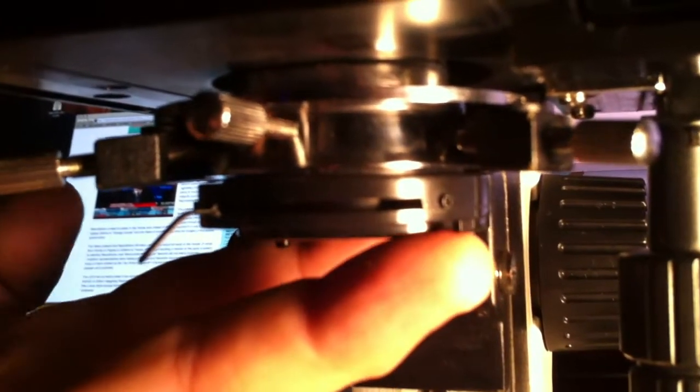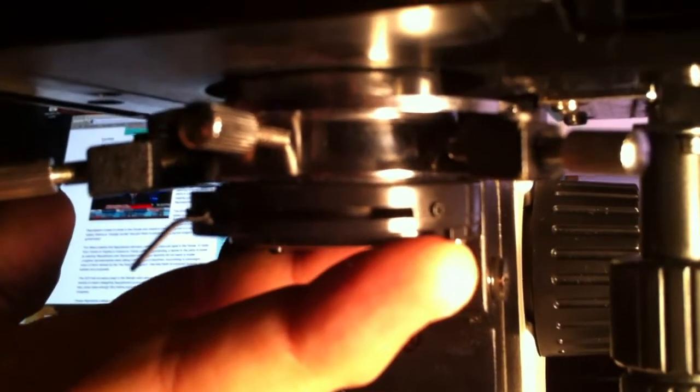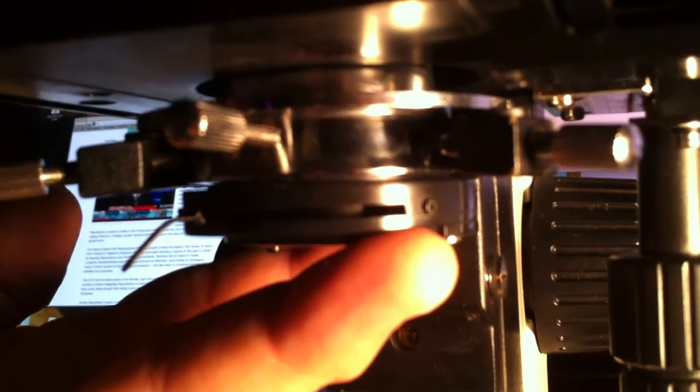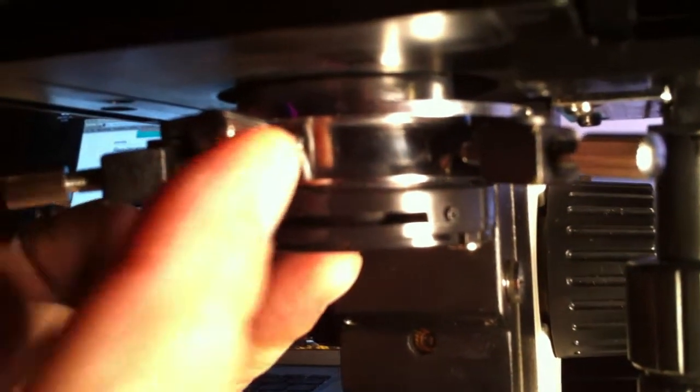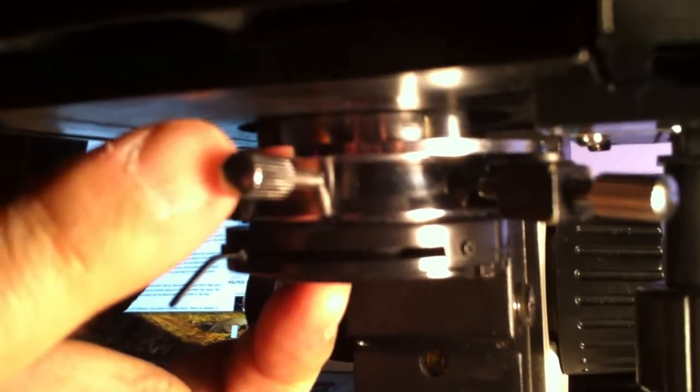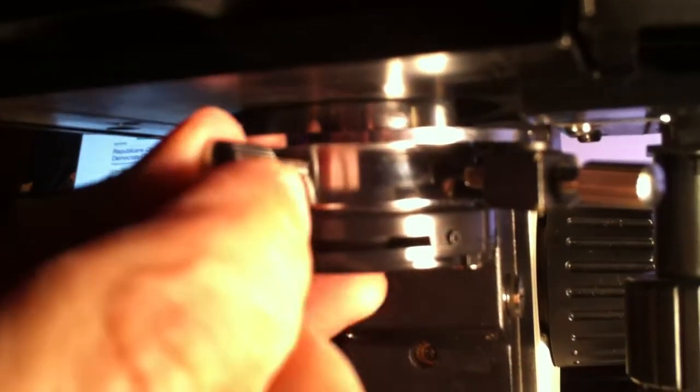What we're going to do is just show a couple ways that it could be removed, possibly by a student. The easiest way to do it is in the front, there is a screw here that's very easy to get your hands on.